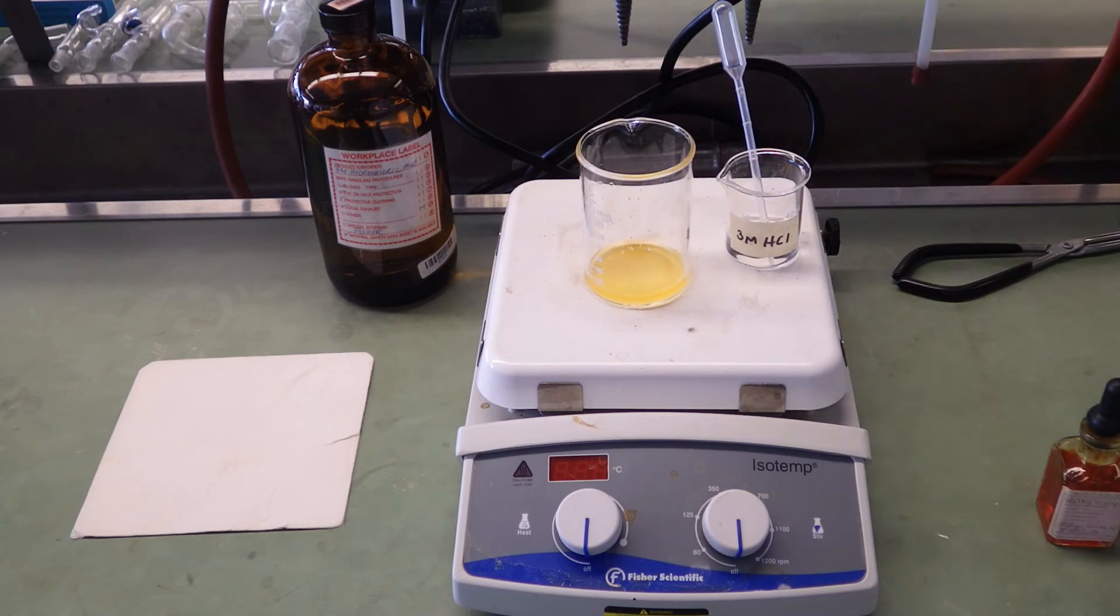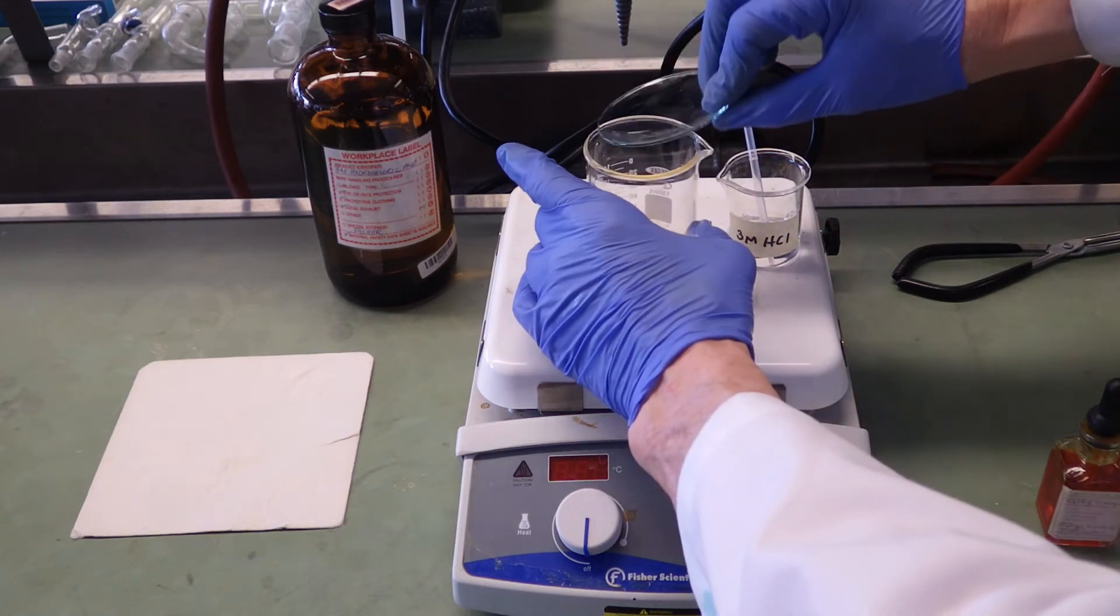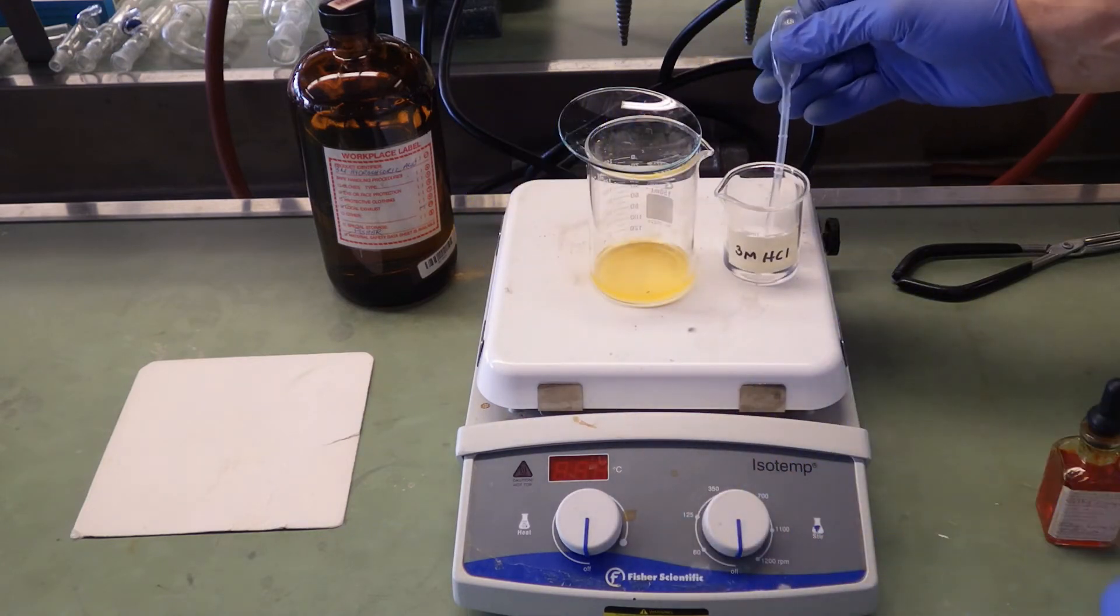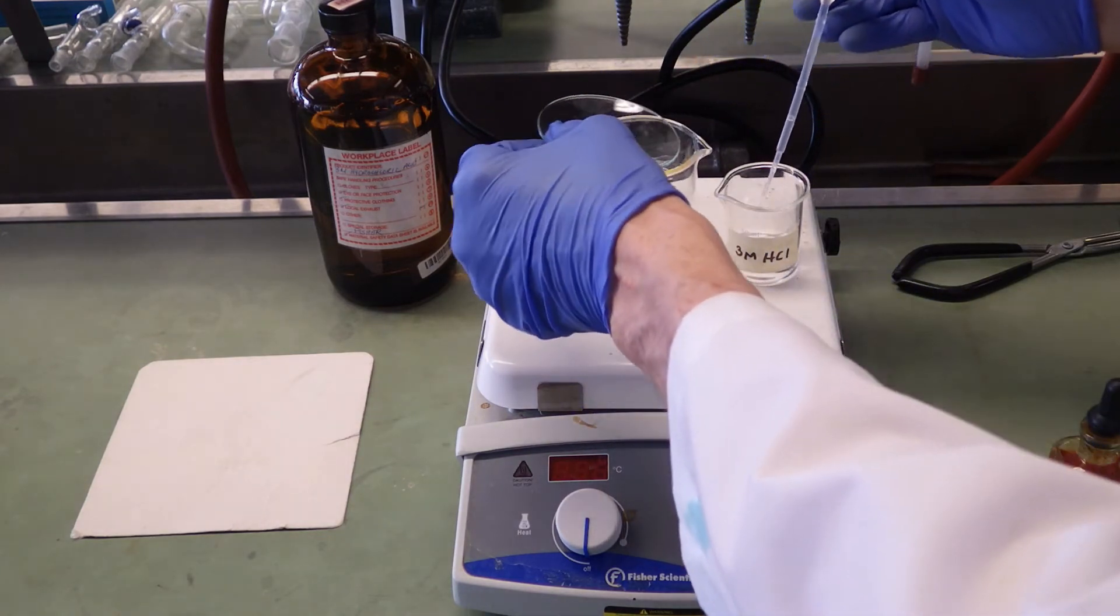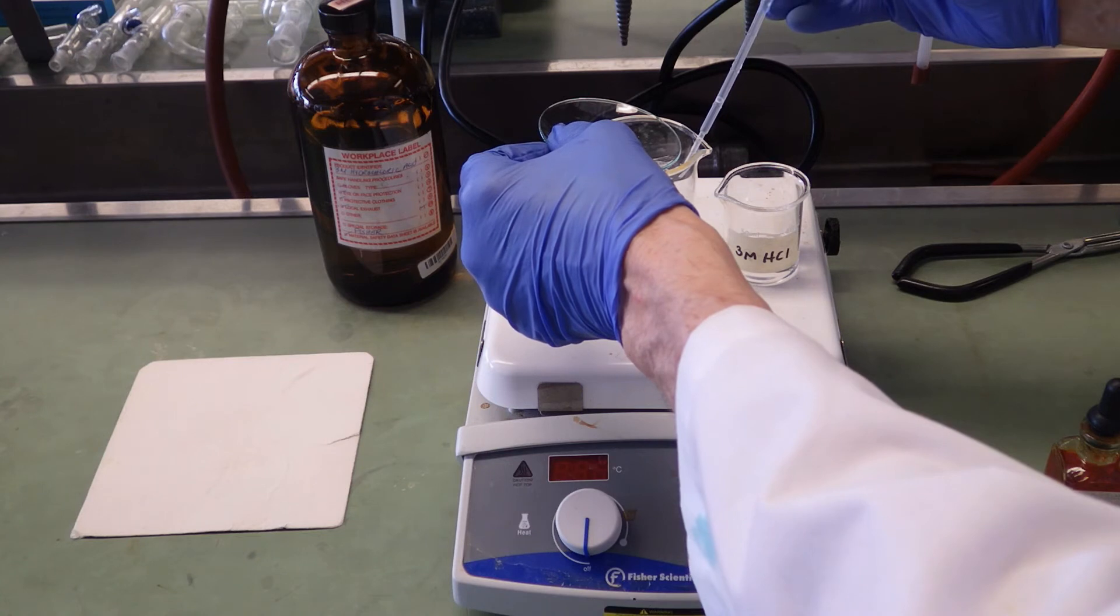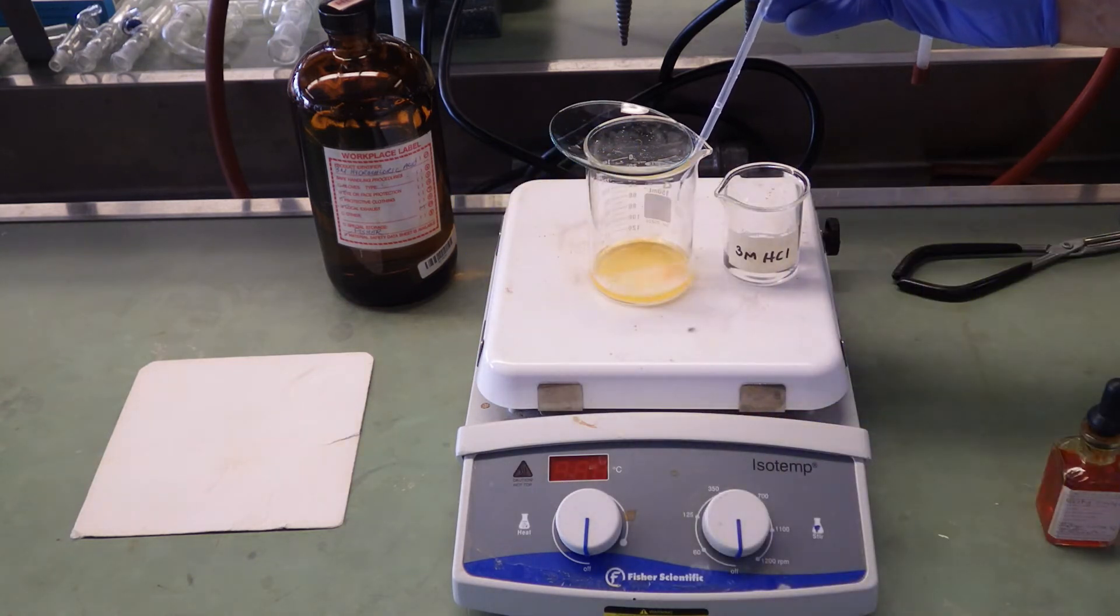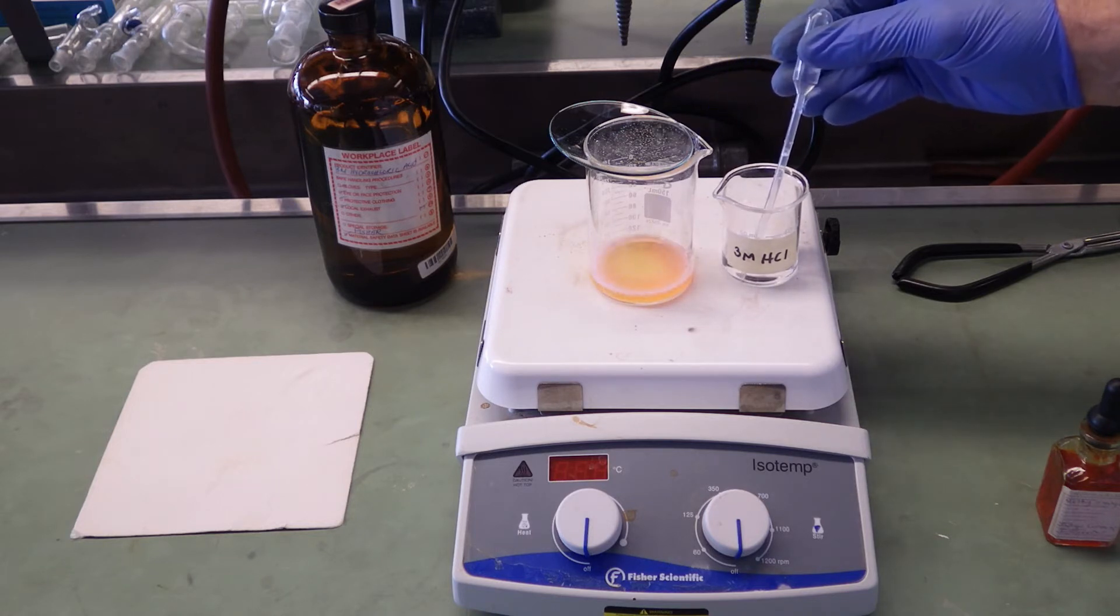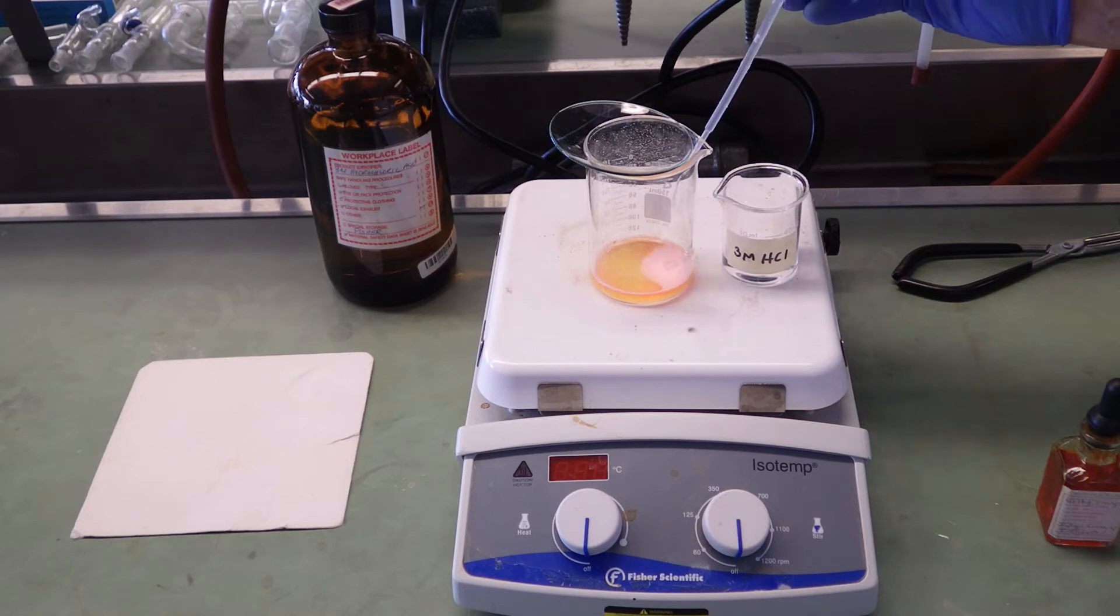I'm going to add it a little bit at a time because it does effervesce quite a bit. I don't want to lose material. As HCl is added, there's a large volume of CO2 gas that's being released. It's effervescing.